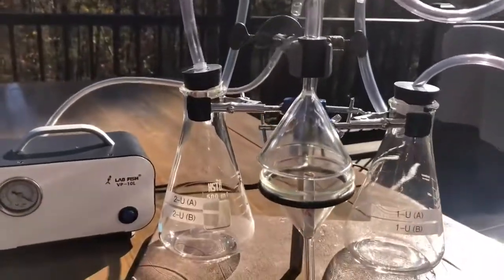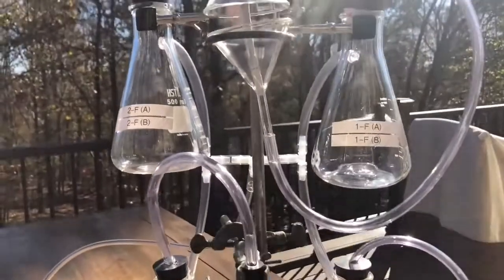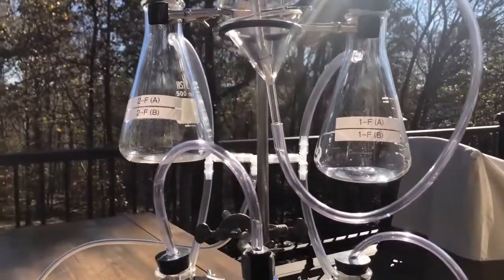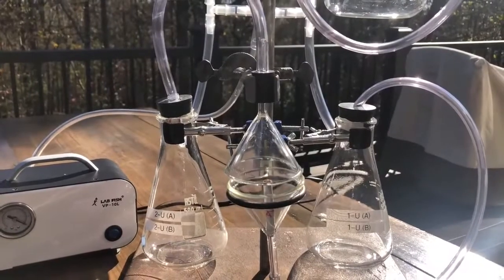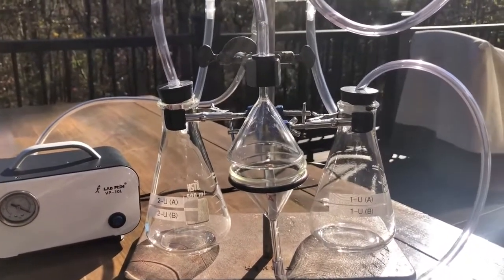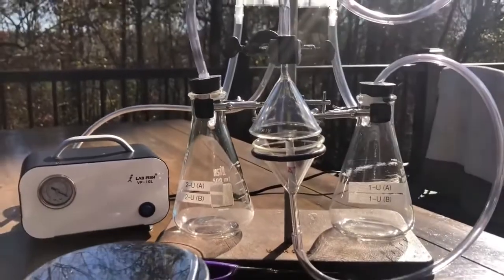It's important that we leave a little air gap between the funnels because, as you know, combustion requires oxygen. So now we're going to turn on the pump and cross our fingers and see if we can light these guys. We're going to try to get them to burn all the way down to that little red line, and then we will break the seal between the pump and the cigarette itself, and then we will get masses for the filters with the solids collected on them.